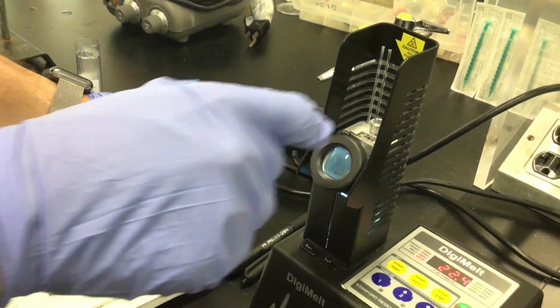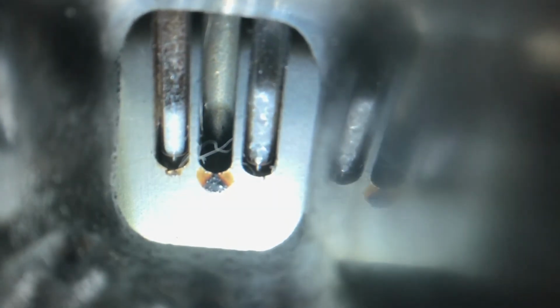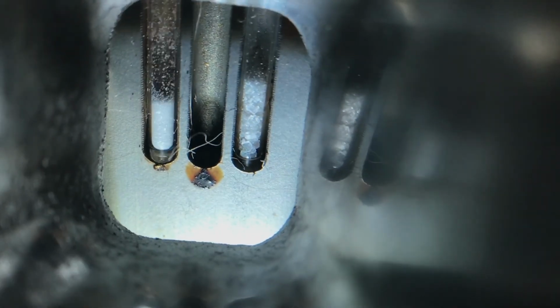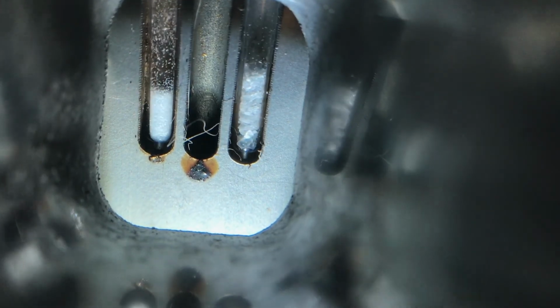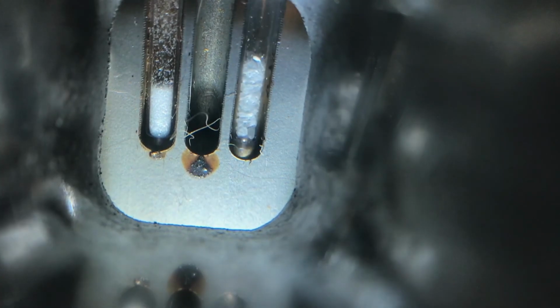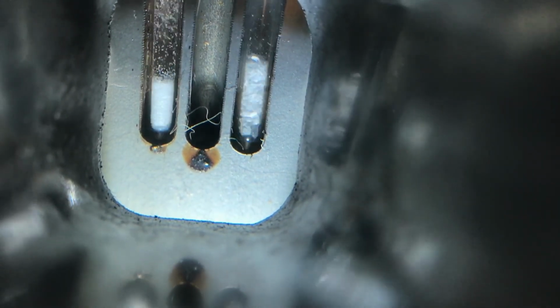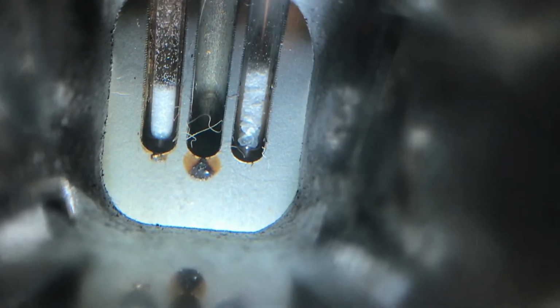And so then we're going to put it into the melting plate, and these are the two melting point capillary tubes. The one on the left is our sample, the isolated sample, and the one on the very far right is pure acetylsalicylic acid from the company. And so we're going to watch both melting points at the same time to try and see and get that melting point range.